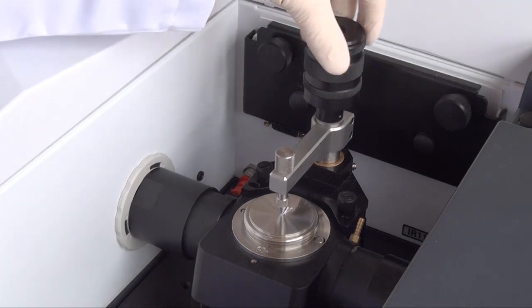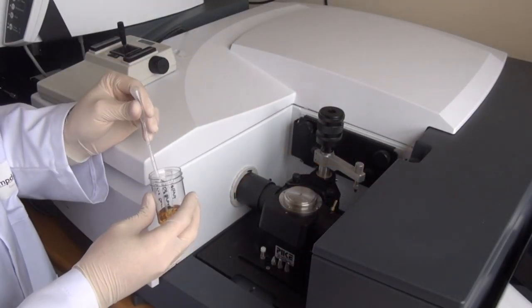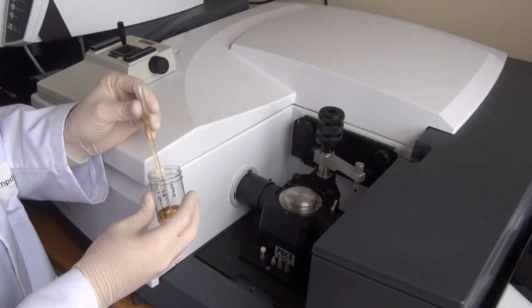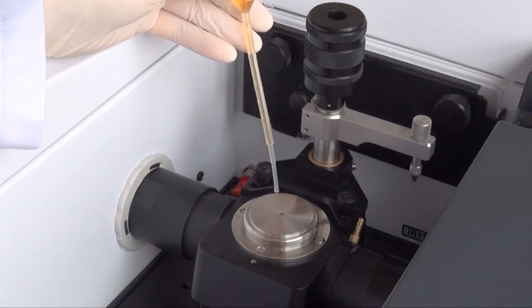Powders can be analyzed by crushing them against the diamond crystal. Liquids are analyzed by placing a small drop of the test liquid on the diamond crystal.